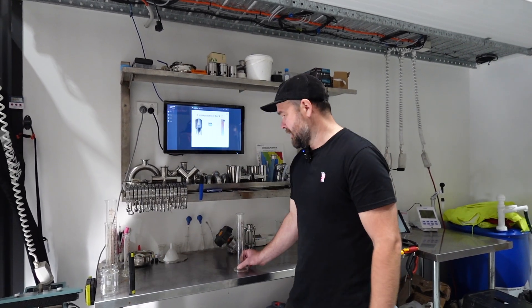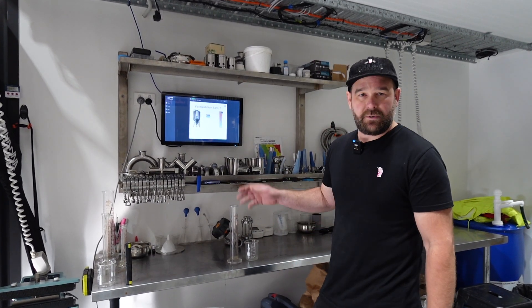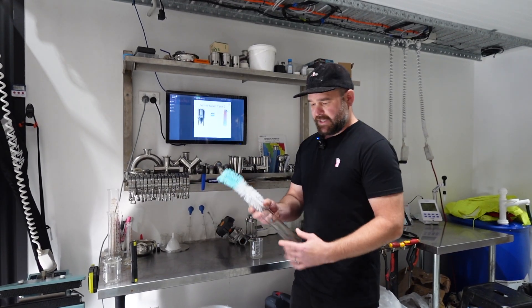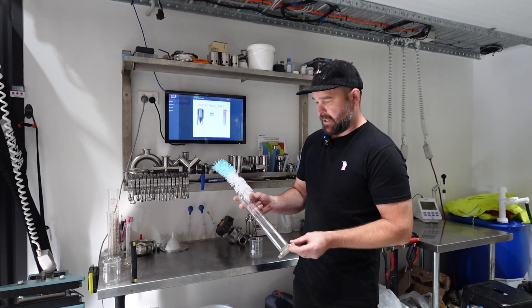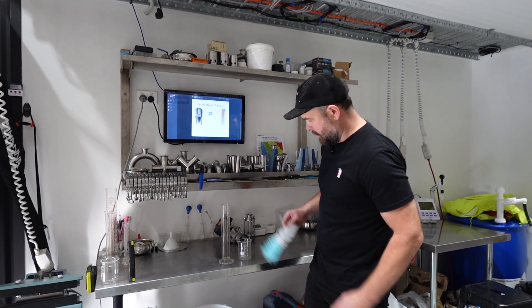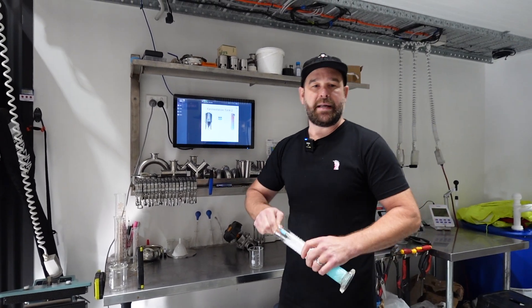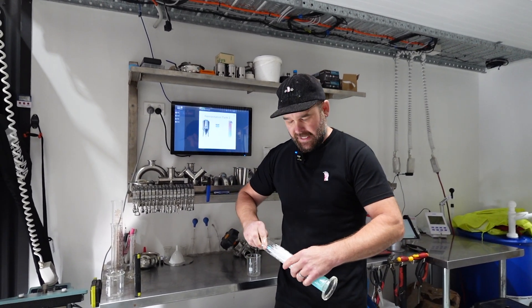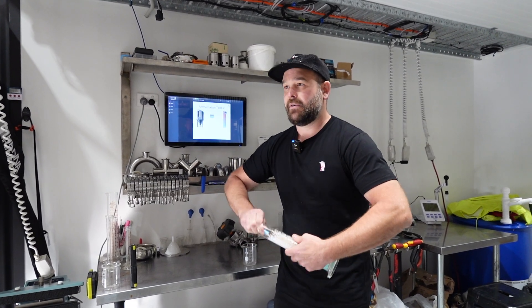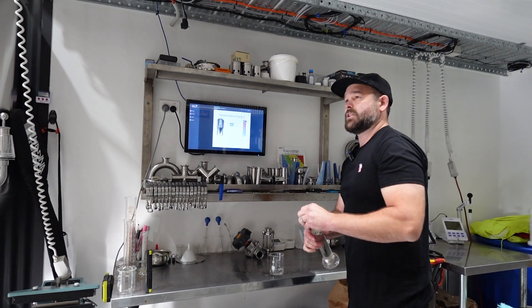Things we're going to need: your glassware. We're going to clean our glassware right out with our pipe cleaners - clean our test tube, 250ml test tube glassware. We're also going to have our little 250ml beaker. The reason we're cleaning out our glassware is because it's a sensory evaluation, so we don't want any off-flavours.